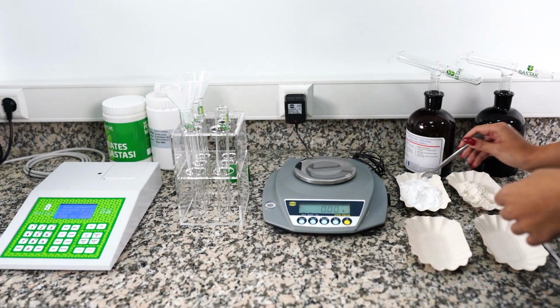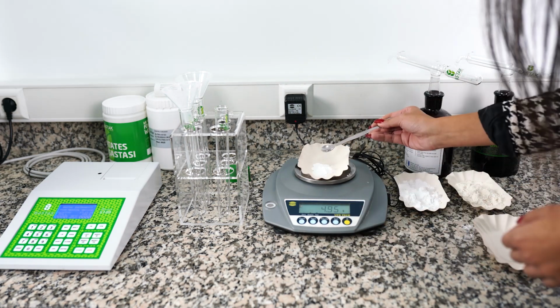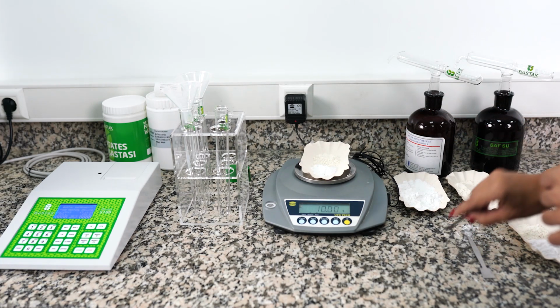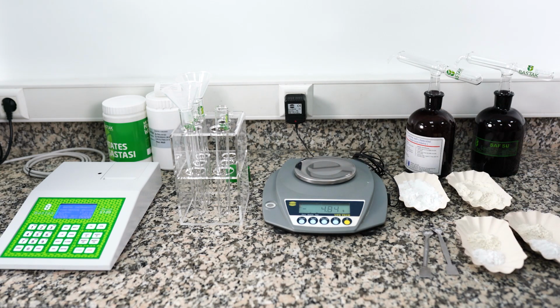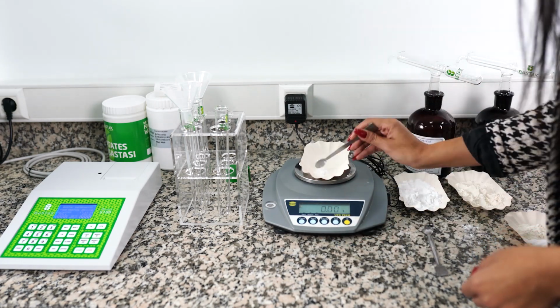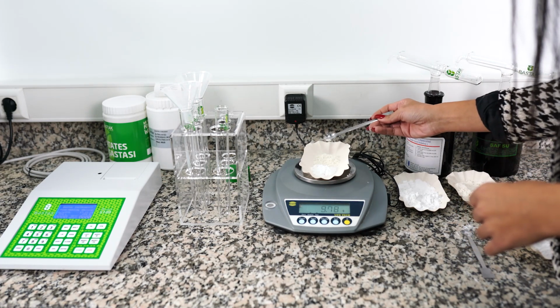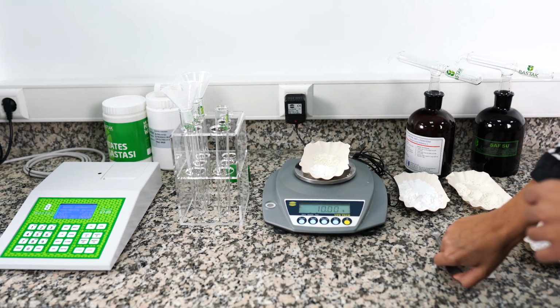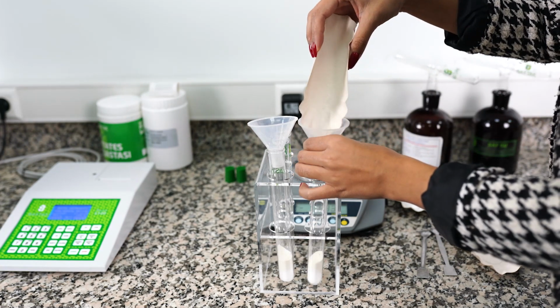The sample to be analyzed is homogenized by mixing in a plastic container with a lid or in a bag. Weigh 7 grams of flour, which is the standard according to 14% moisture value, from 4 or 5 different parts of the homogeneous sample. The same process is done for the second sample. The weighed flour samples are transferred to dry and clean test tubes with the help of a funnel.